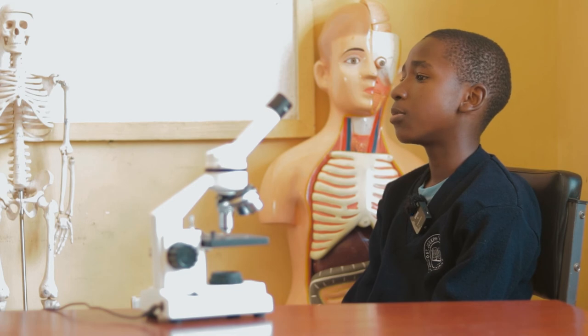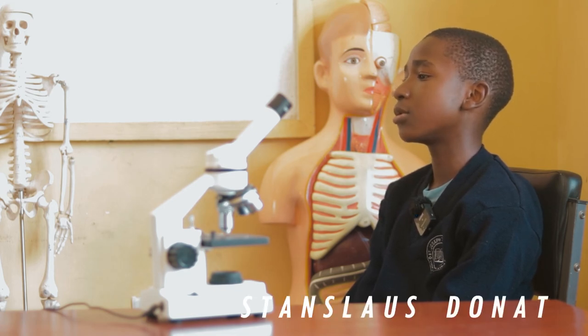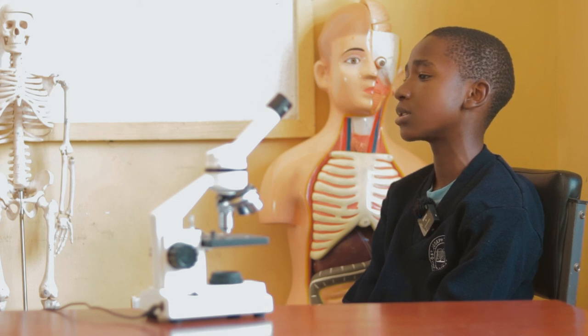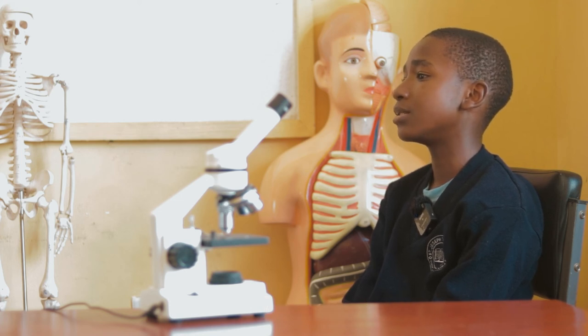All microscopes are stored in a glass cover. You must always keep a microscope covered when not in use. If you leave your microscope, it should be stored in a cabinet.